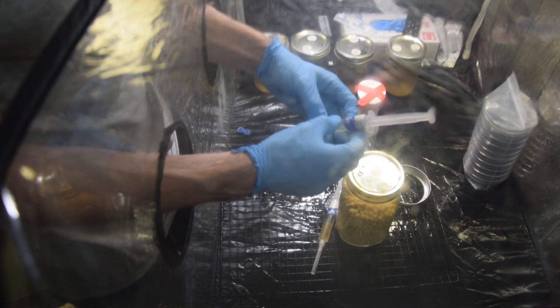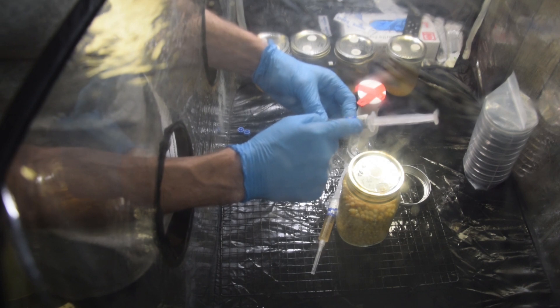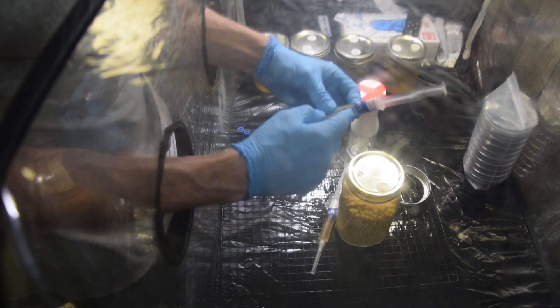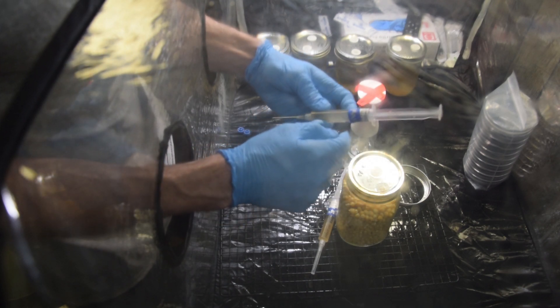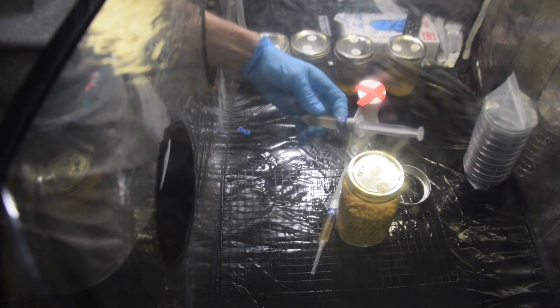The supplier usually only does right at 10, which is fine. Nonetheless, the label gets in the way, so you can't see that first cc or two. It's always kind of annoying. Then I put extra tape around here because my rubbing alcohol was making the names bleed and I didn't want to lose them — I almost lost labels off five of my other medicinal mushroom varieties.